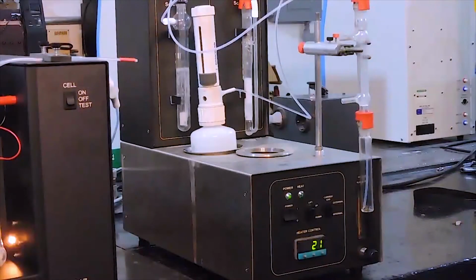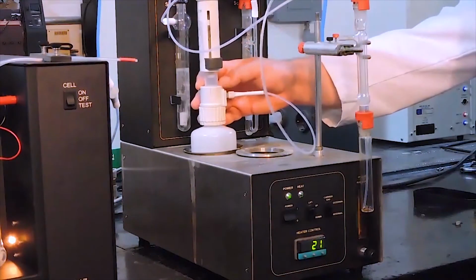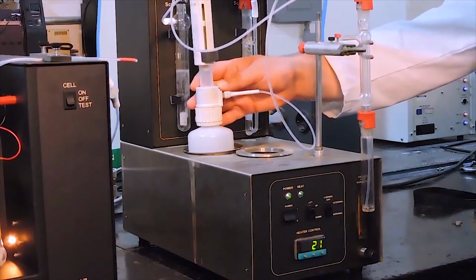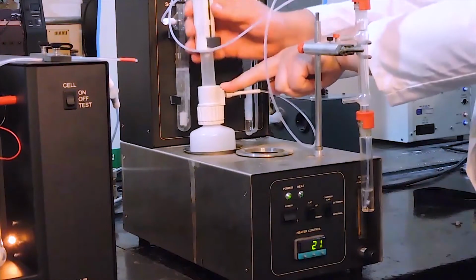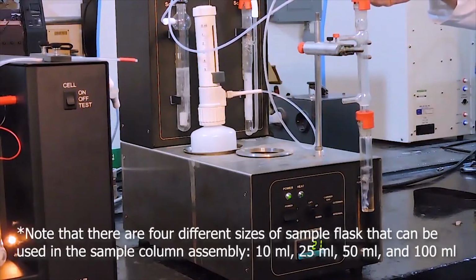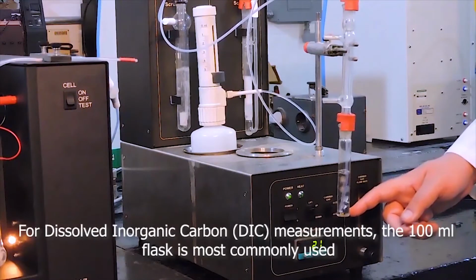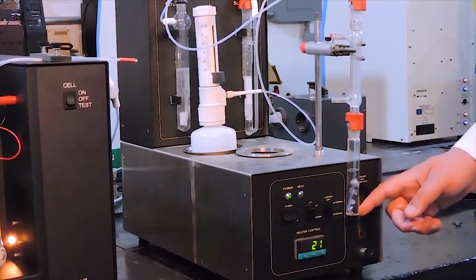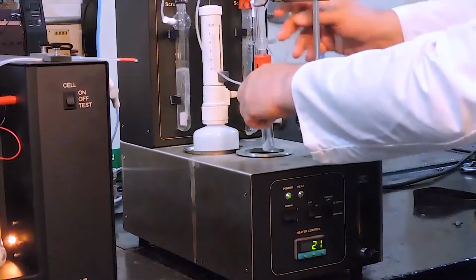When we press Begin Analysis on the display, it's time to pump the acid. Slowly pump 10 milliliters of acid into the system. You should see the acid enter the system and the carrier gas begin bubbling through the acid. The sample column assembly can be lowered into the heating block if you want to use heat to assist CO2 release.